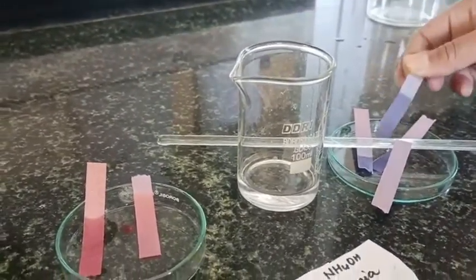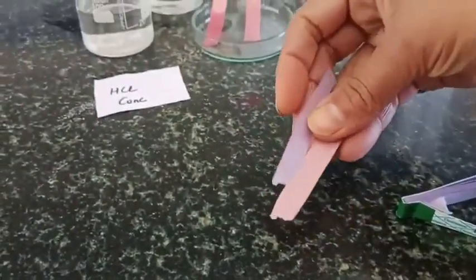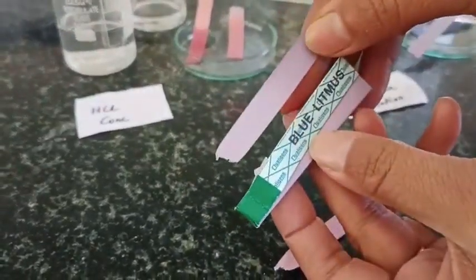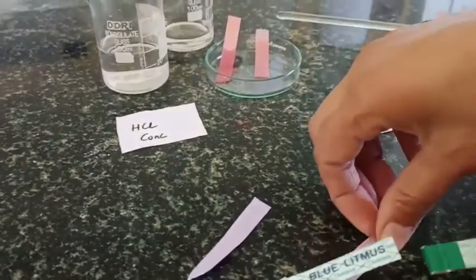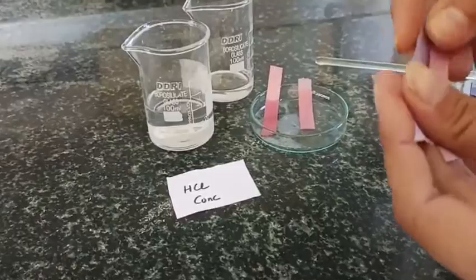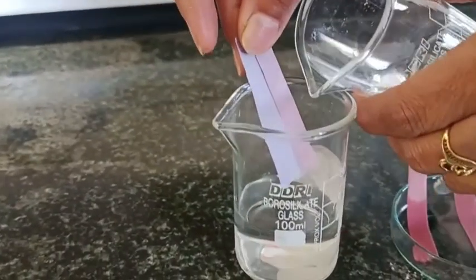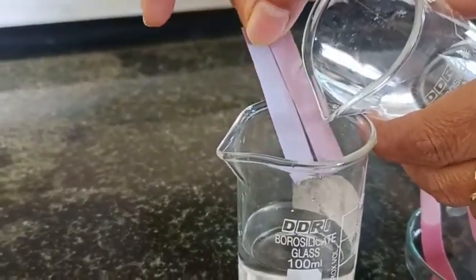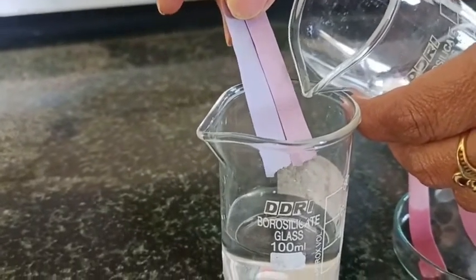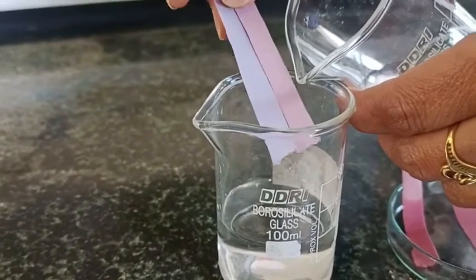This corner has excess acid, so it doesn't turn. Now you can see the reaction on both blue and red litmus — the colors are not that clear here. This red litmus again turns blue by the fumes when it is dry. You can see the same colors we observed: blue is blue, but red also becomes blue because of the fumes of NH4OH.